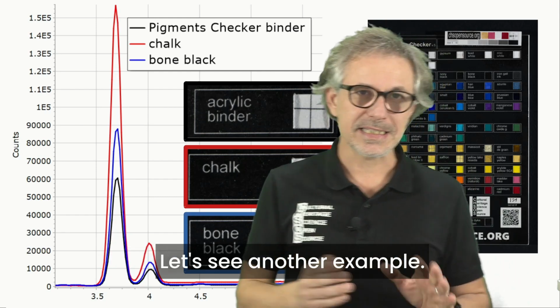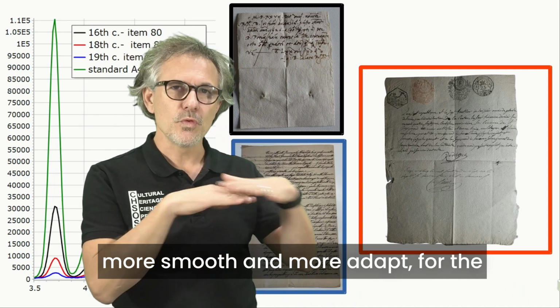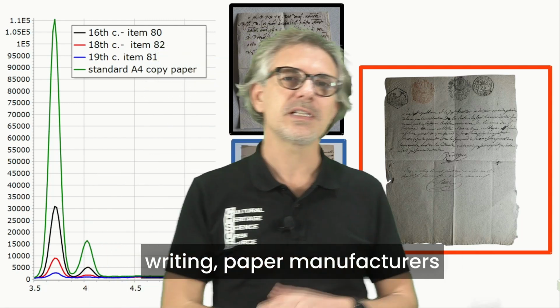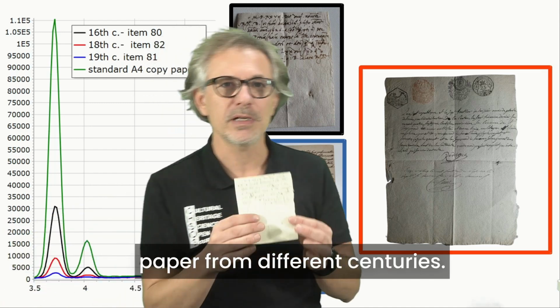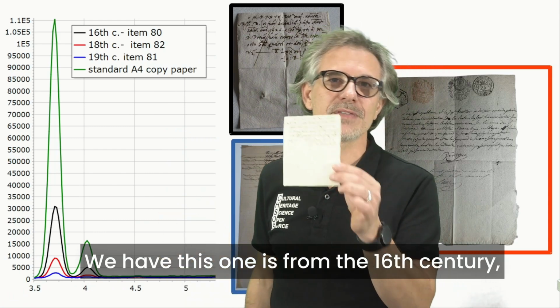Let's see another example. In order to make the paper feel smoother and more suited for writing, paper manufacturers added calcium carbonate. I tested three samples of paper from different centuries. This one is from the 16th century.